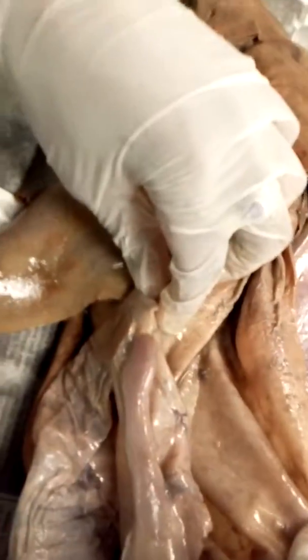And this is the stomach — it's all cut open though. I don't know who did this, but it's supposed to probably be in that sack, I'm assuming, because the other stuff is liver and stuff. This is the stomach. Somebody cut it open. The stomach is cut open.